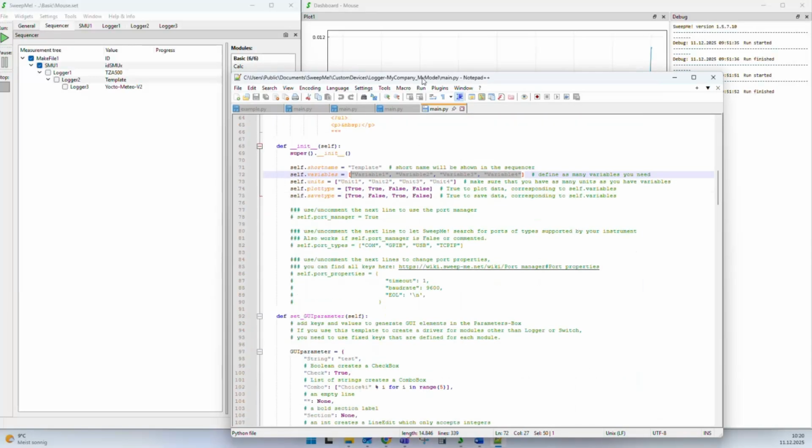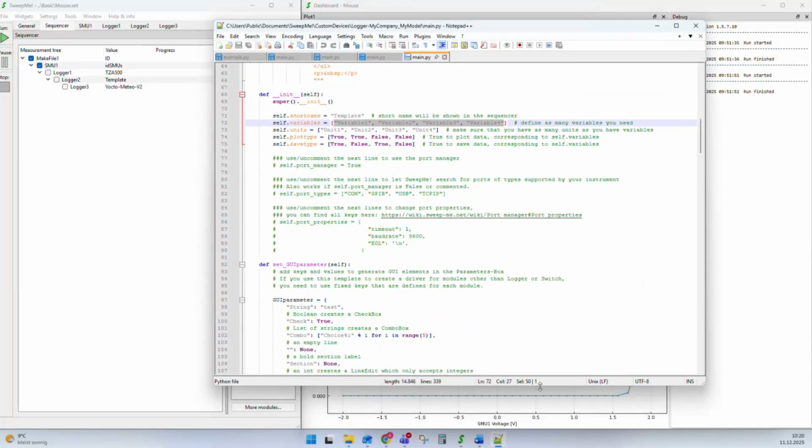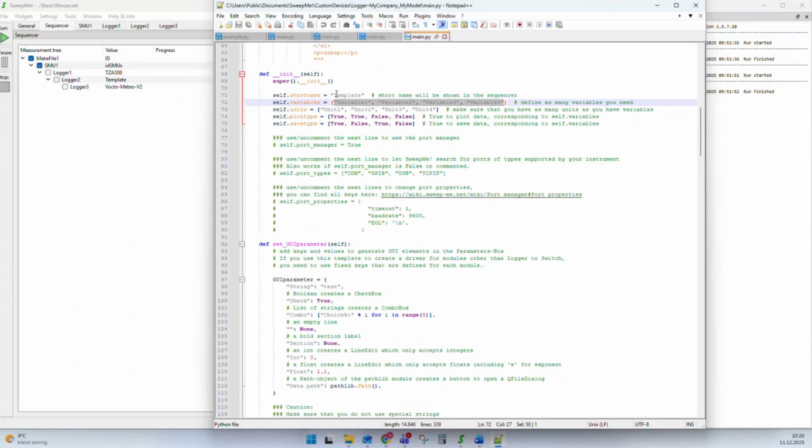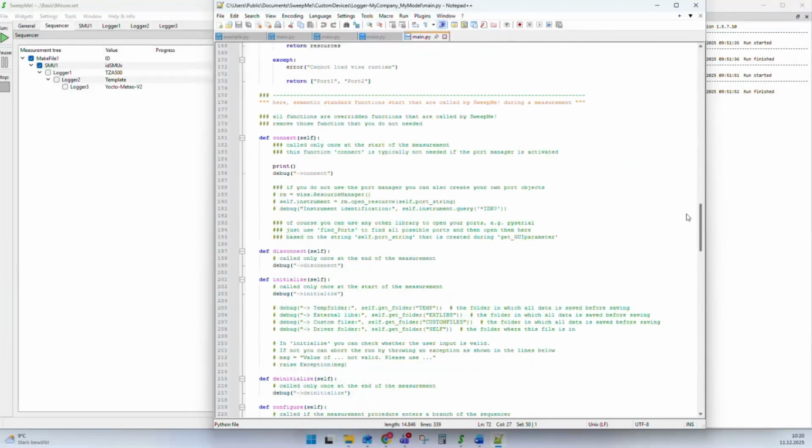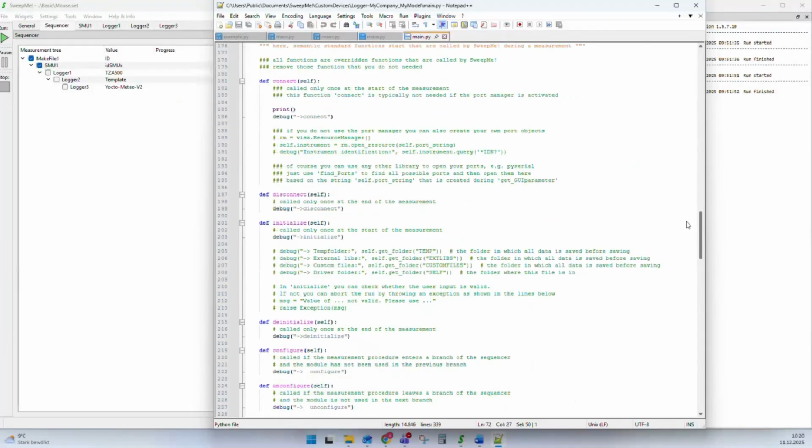So coming back to the driver structure, we can now see there are a couple of functions. And the most important concept of a SweepMe driver are these semantic phase functions. Let's say this is something maybe we invented at SweepMe, this phase function scheme, because it helps us to add a lot of instrument drivers of different types, whether it is a monochromator, a temperature sensor, or SMU. They will all follow this scheme of functions.